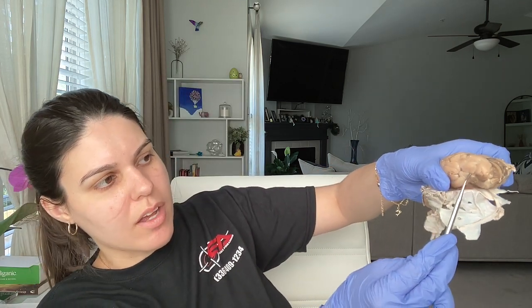Okay. The next one is the longitudinal fissure, and that would be right here. Then we have the lateral fissure, and the lateral fissure, like its name says, is right here, and we can see it between the frontal, temporal, and parietal lobe. Then we have the corpus callosum, and the rest of the internal fissures that we have to point out.